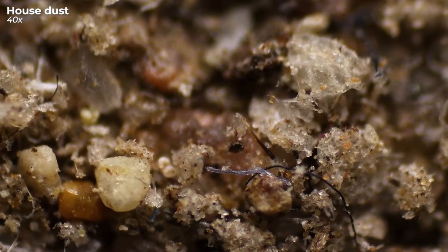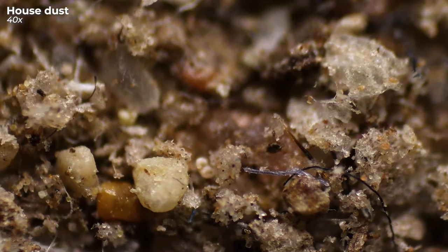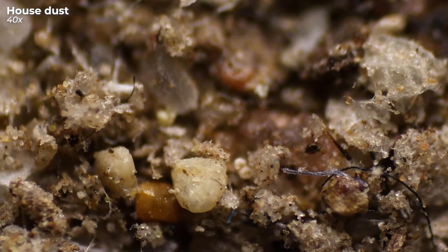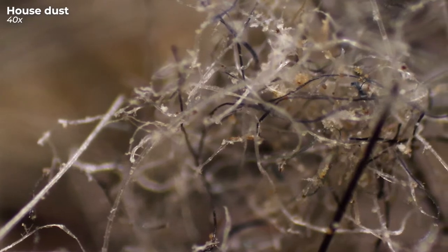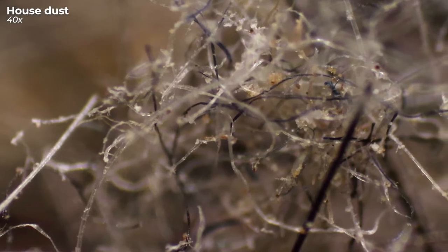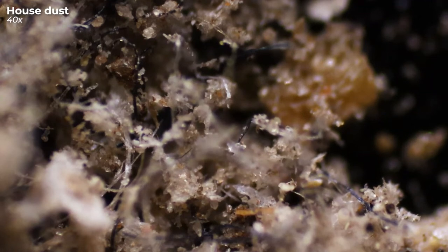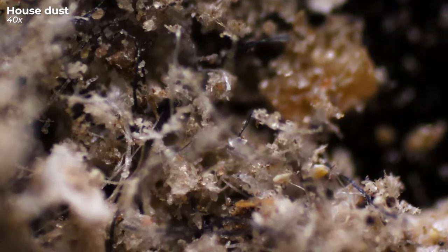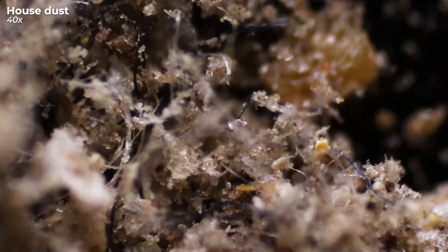First, let's get a rough overview of what's in the dust. It is composed of an incredible amount of tiny particles and also contains many fibers and hairs. But there is someone else hiding here — behind these odd movements probably lurks the first uninvited but unfortunately also unavoidable roommate. We'll get to the bottom of this later.